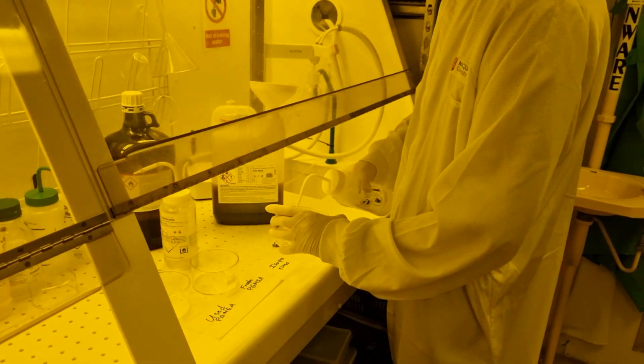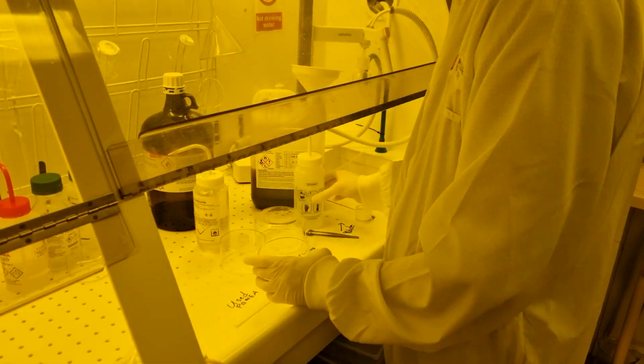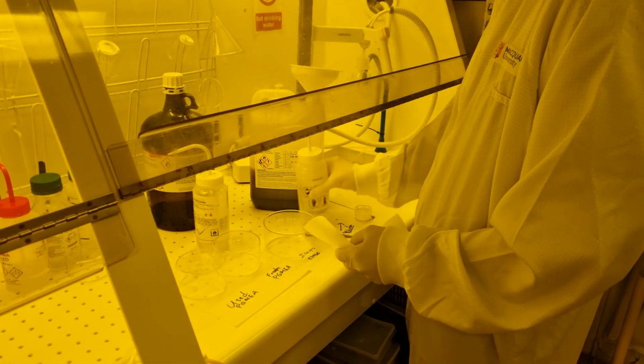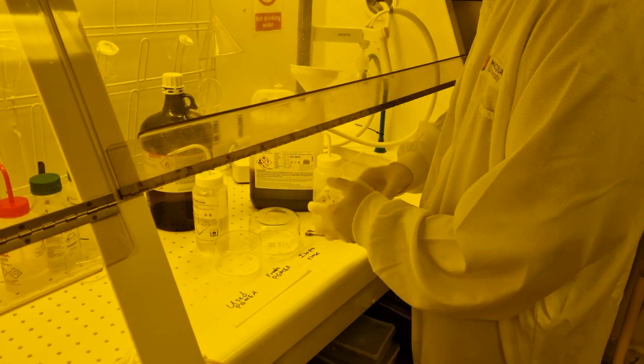But if your wafer has white streaks on it, it probably needs more development. If your features are wrinkled or bent, they probably need more exposure energy or less development time. If your features are lifting up in some places, you might need more exposure energy, a cleaner wafer, or more plasma treatment.